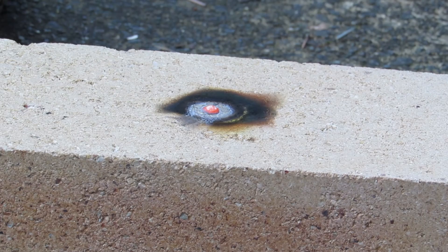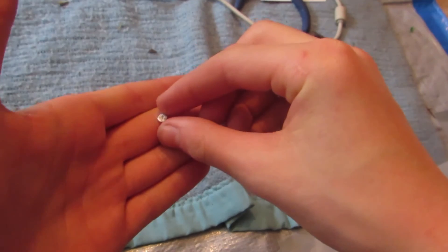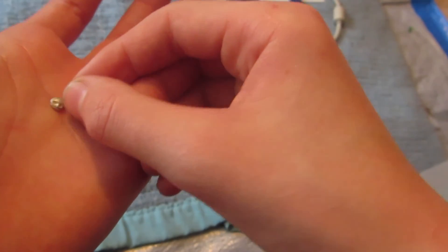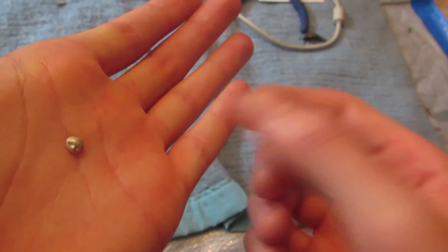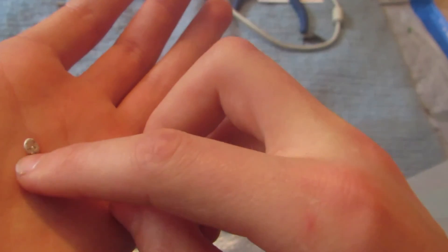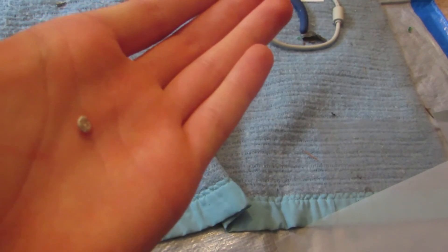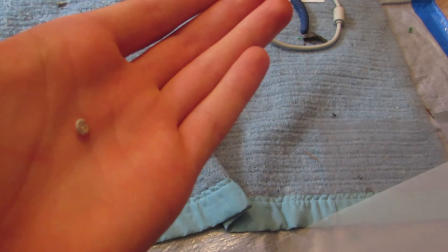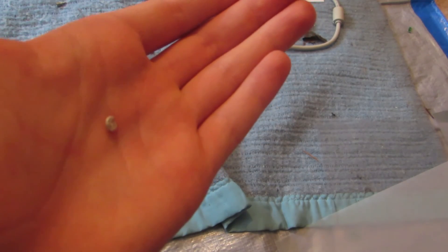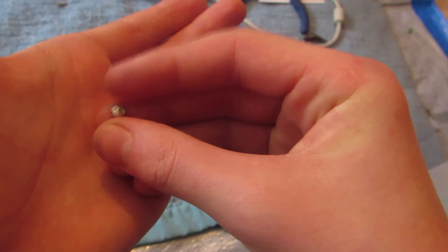Well, that didn't take long. So we're back inside, and you can see there is our small little bead of nearly pure silver. After that long extraction process, we have a nice beautiful bead of silver. No brick stuck to it as I thought there would be — it came off quite nice and easily. So there's how to get pure silver metal out of computer relays, which you can find in nearly any circuit board — normally the more complex circuit boards such as a computer. Hope you enjoyed, and hope you can make some silver like I did. Thanks, bye.